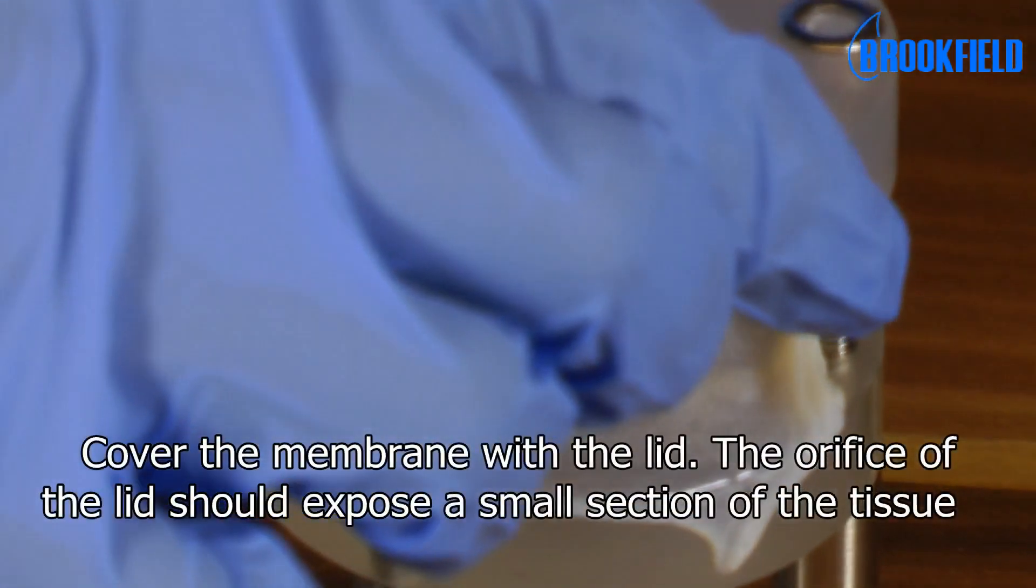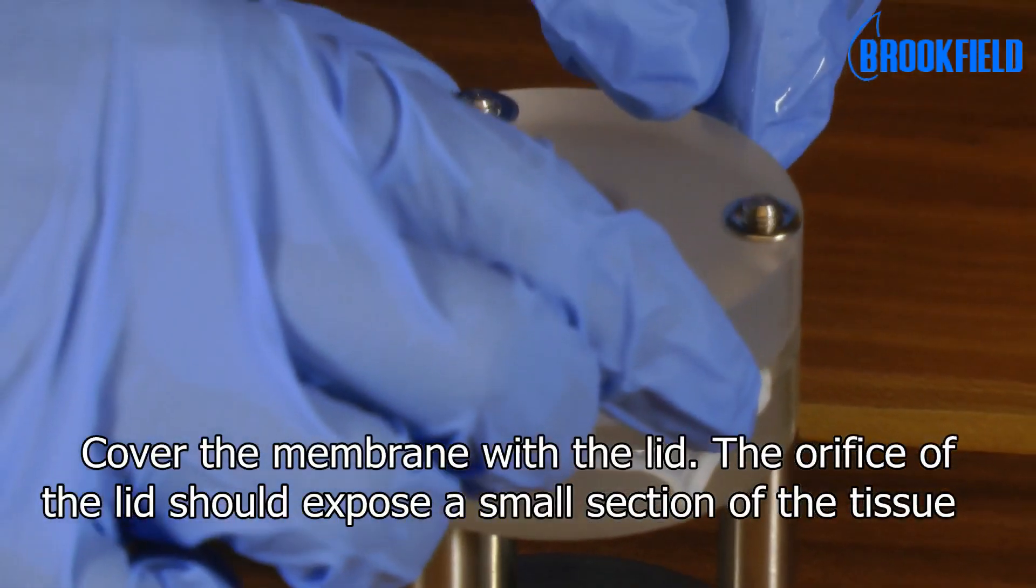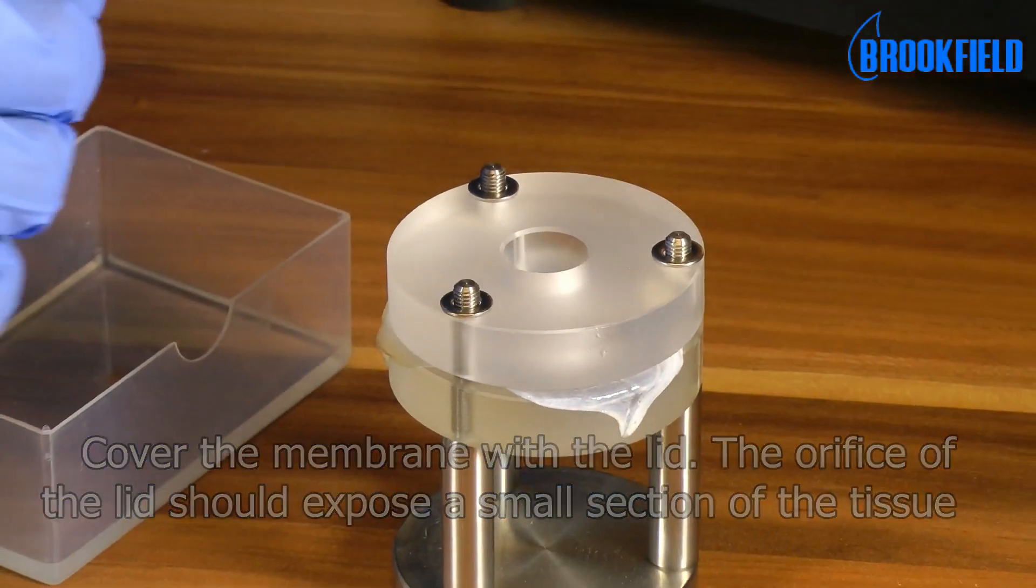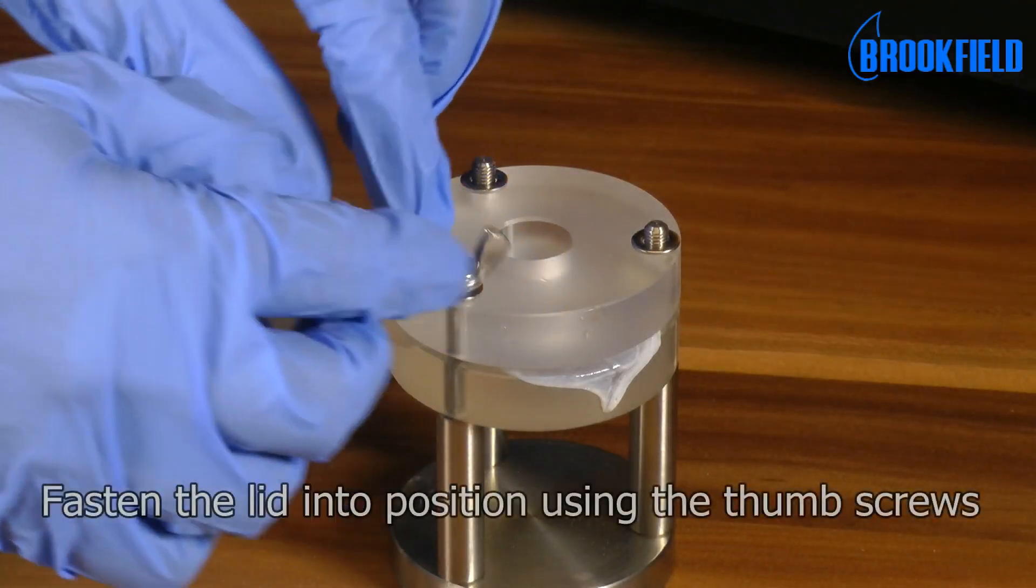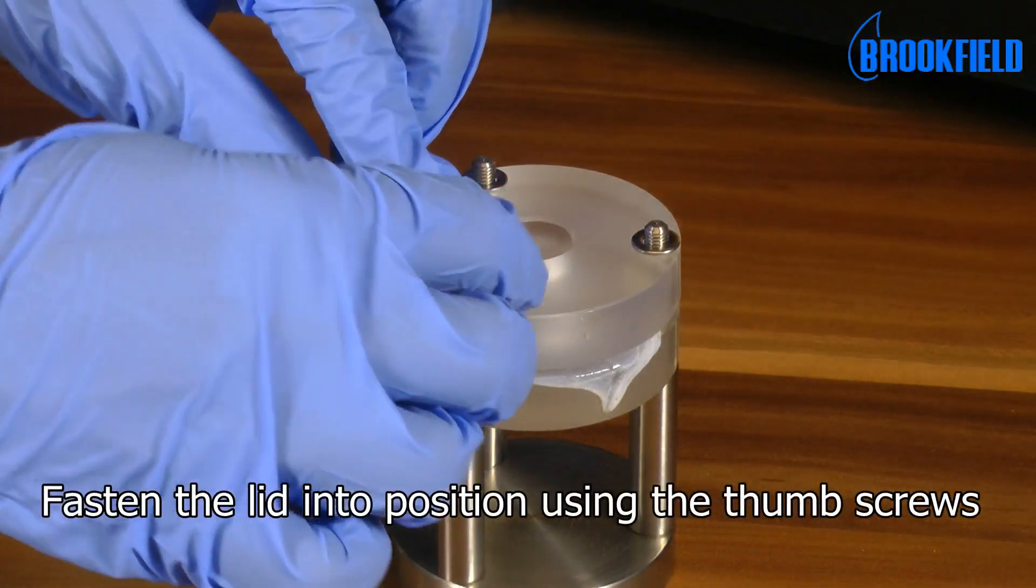Cover the membrane with the lid. The orifice of the lid should expose a small section of the tissue. Fasten the lid into position using the thumb screws.